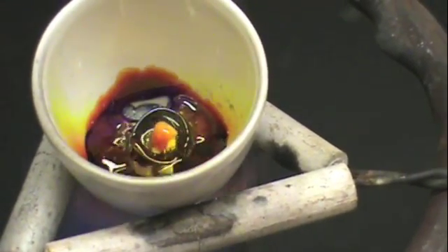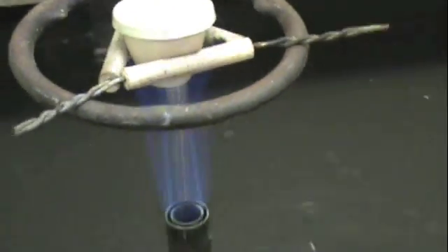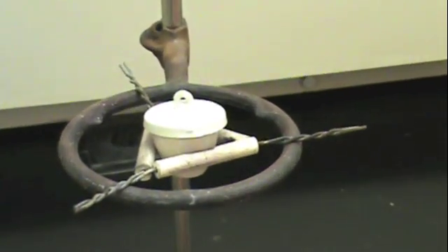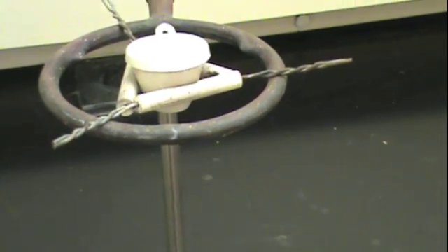Once this occurs, you will want to get your crucible lid ready and cover the reaction completely. Then remove the Bunsen burner flame. You will want to allow this to react for five minutes undisturbed.